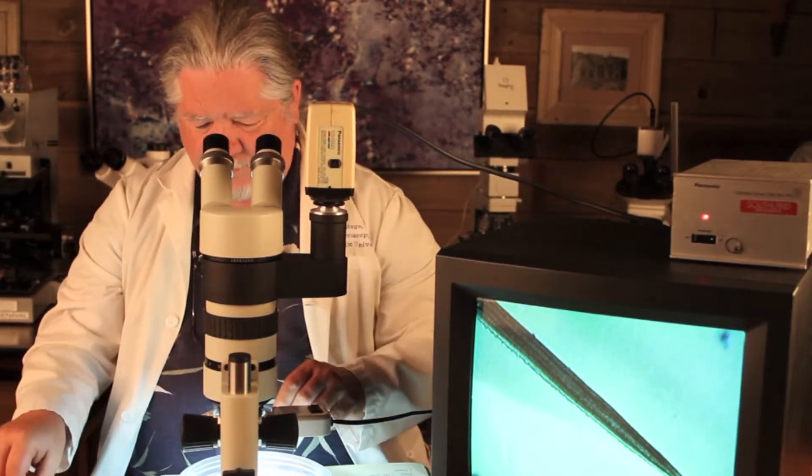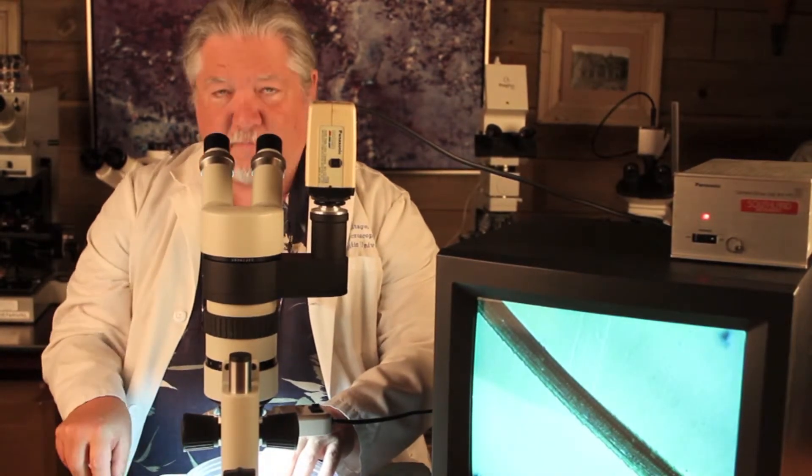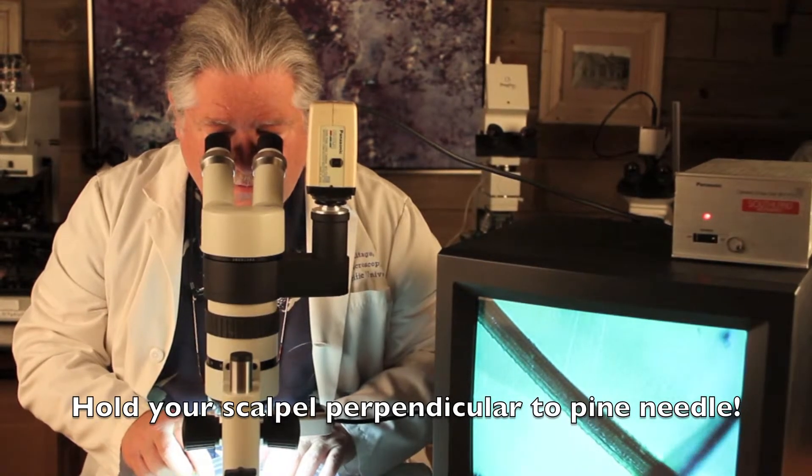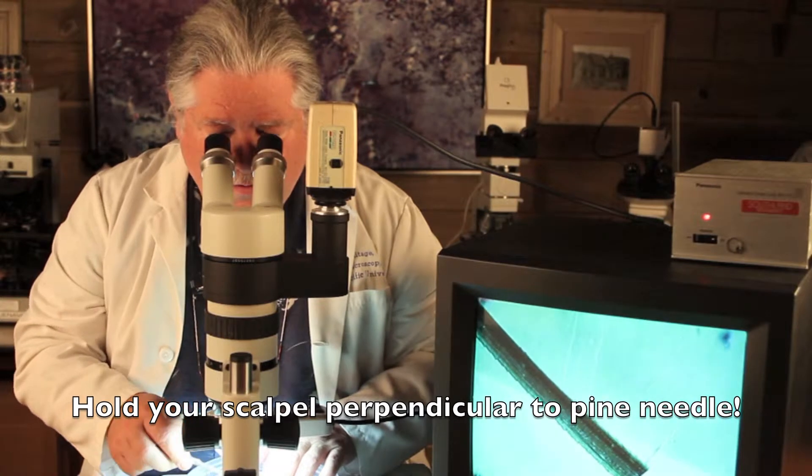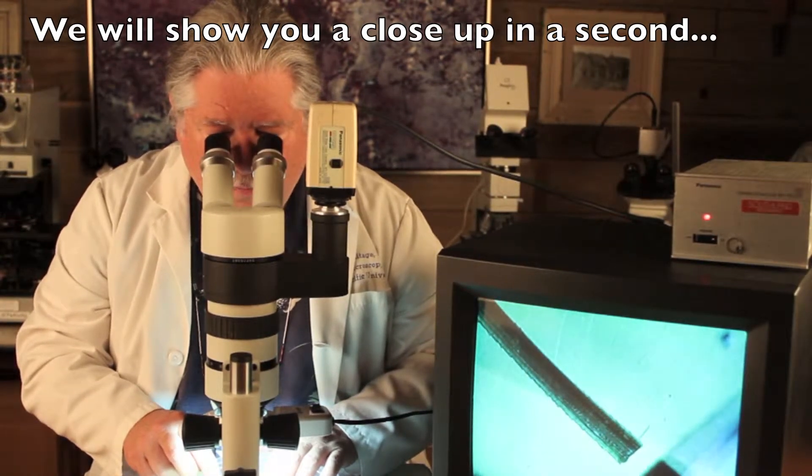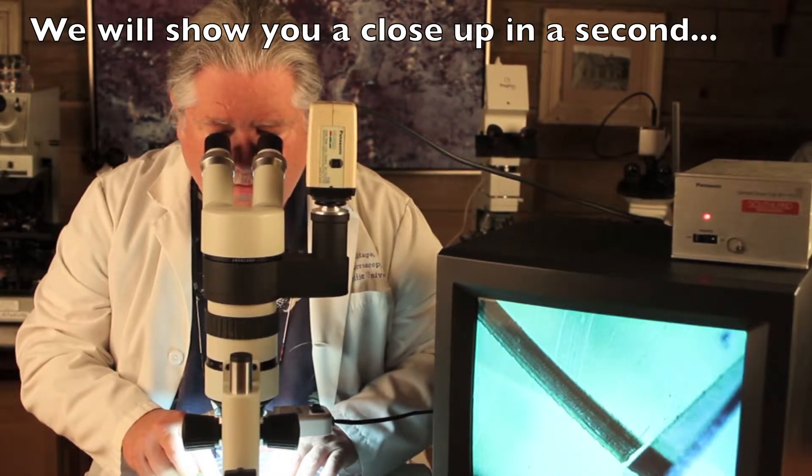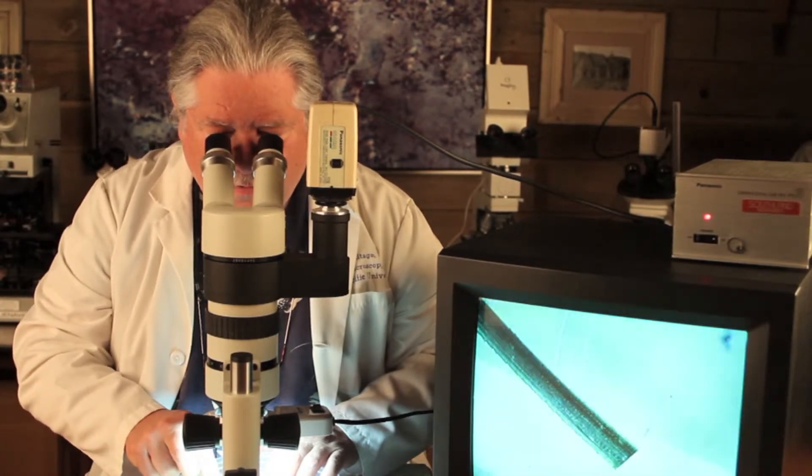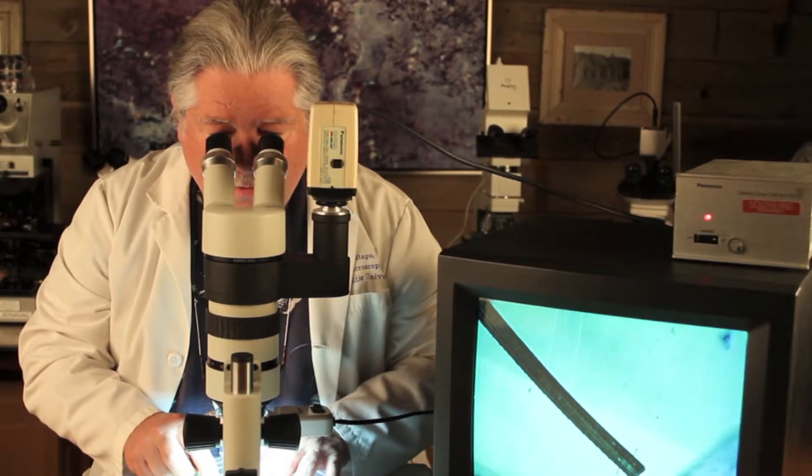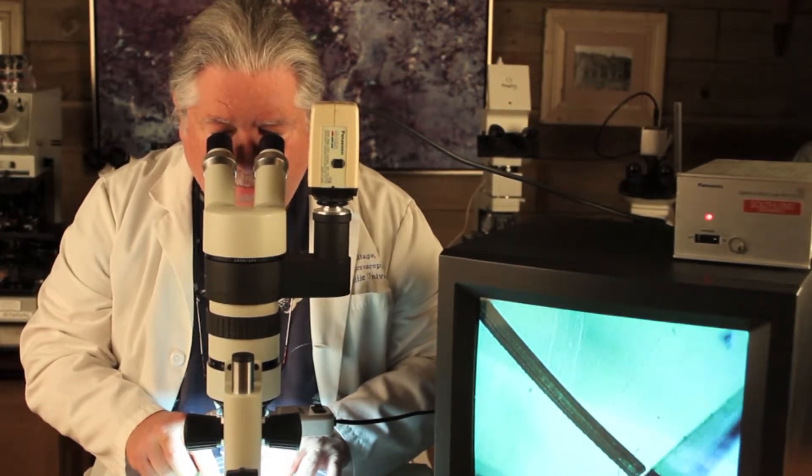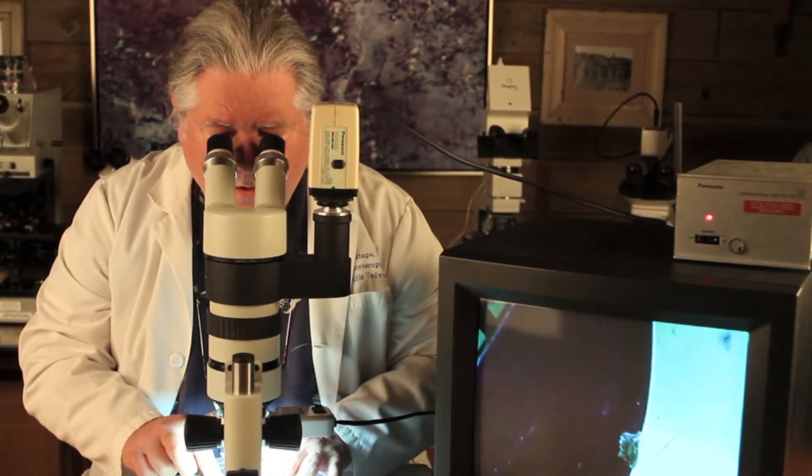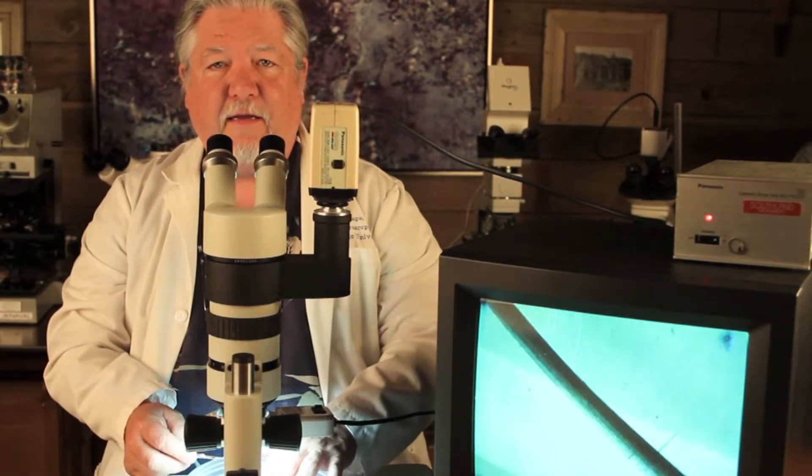But let's try to make a thin section of this. And so I'm going to put one on the screen here. And what I'm going to do is, while I'm looking through the microscope, I'm going to just sever this. So right here I'm going to sever it. I'm using a scalpel. You can also use an exacto knife. And so hopefully you saw that nice severance there. And now I'm just going to make a little thin section off the end of this pine needle. And I want as thin as I can get them because I'm going to put them under the fluorescent microscope. So we made a thin one there. Let me move my finger up a little bit so I have better control of this. That was a little too thin. Let's try again. Well, there's a nice one. So I have a nice thin section there. Hopefully you can see that on the knife edge. And so we're going to put that under a slide under the microscope and see what it looks like.